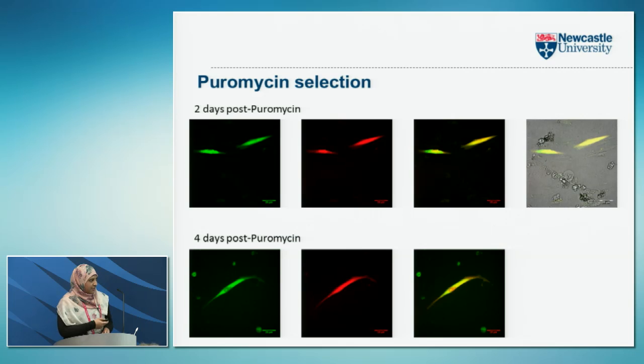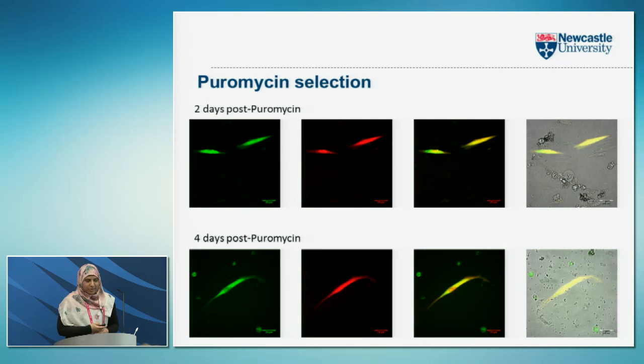The ones that had only picked up the CRISPR knockout plasmid had died off, and only the ones that had the HDR plasmid were surviving, but these cells were few and far between, and they were really spaced out, and we tried to culture them further and they just died off. So after 3 attempts, we decided we better move on to something different.